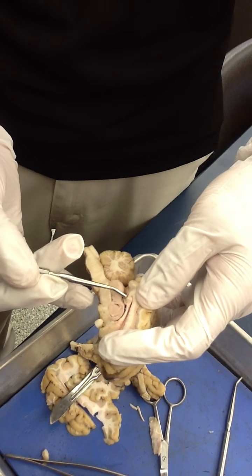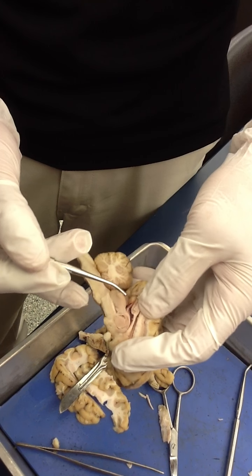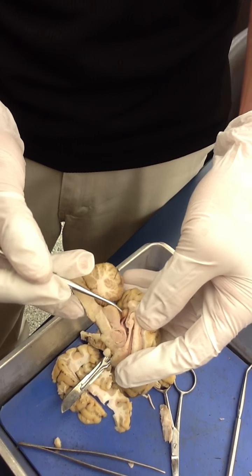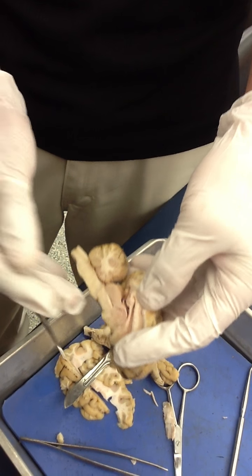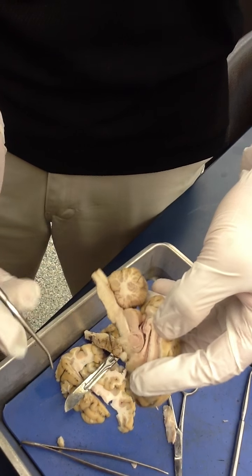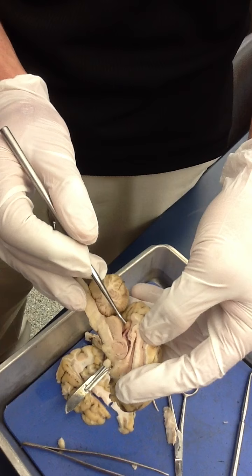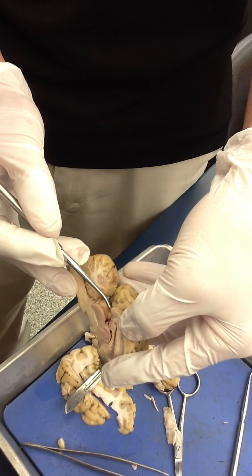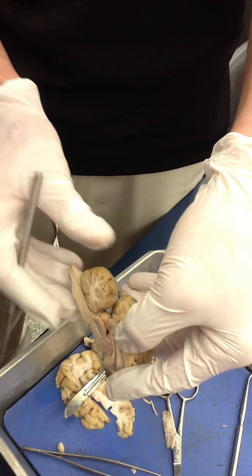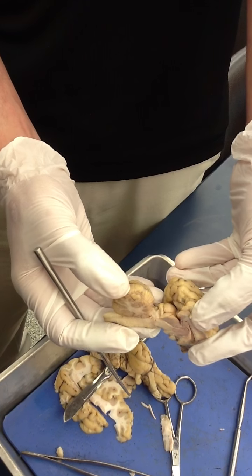That's the habenular nucleus — or I'm sorry, the posterior commissure. This is the pineal gland. So, the pineal gland is easily located because it is just above the corpora quadrigemini.